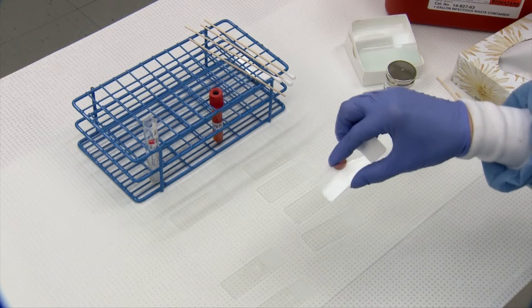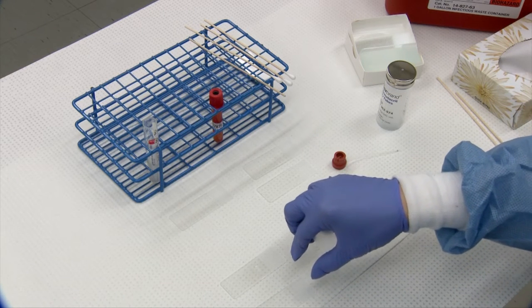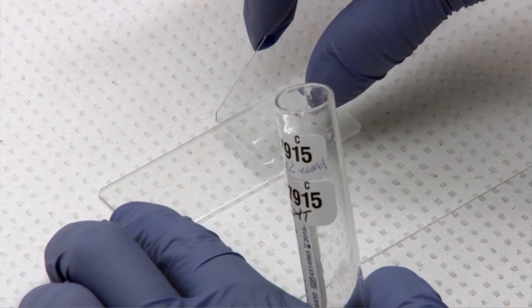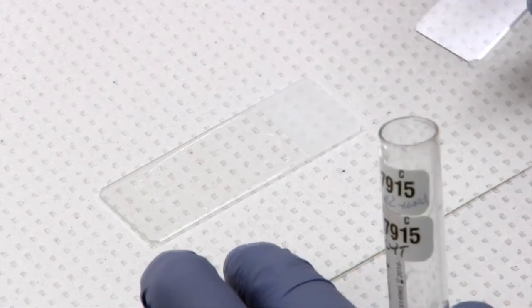So the direct smear, hold your spreading slide very vertically in order to keep all the material on the slide. Just bring it into the drop and push it straight out and that will be your direct smear.